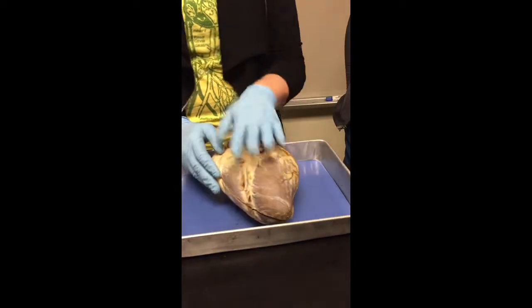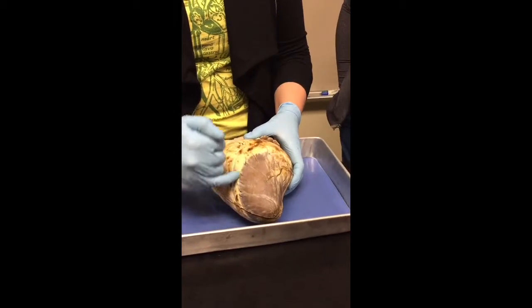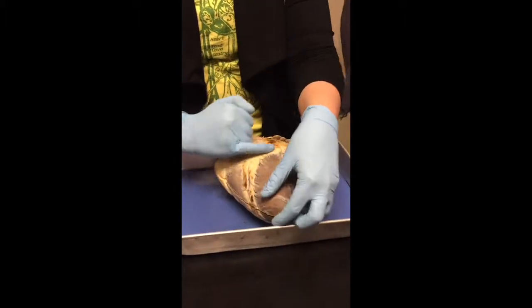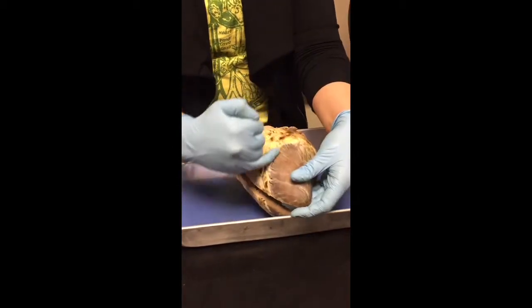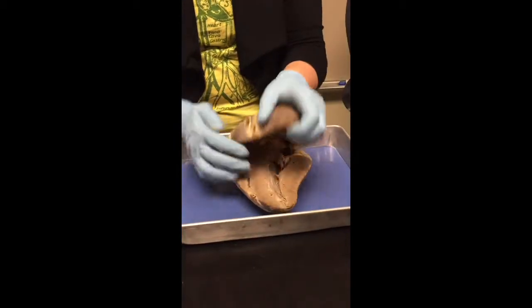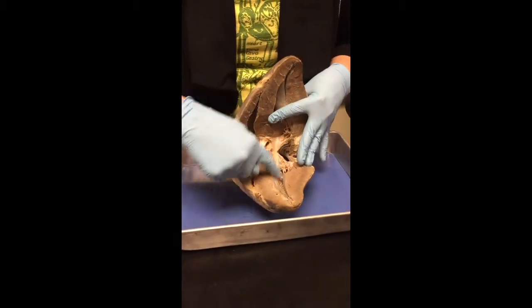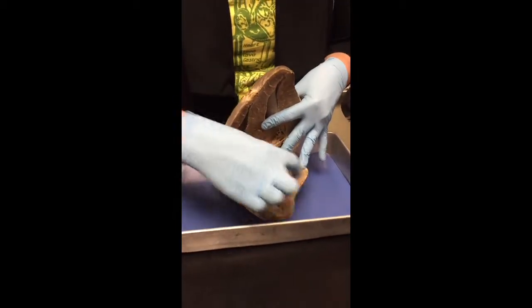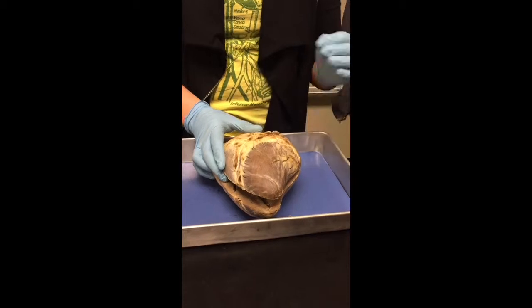On the front of the heart, so here's the anterior part of the heart, this right here, you can kind of see what looks like a groove. This is called the interventricular groove, right? It's just a way to help orient yourself. Interventricular groove, you can see that it kind of goes along with the interventricular septum, right? So left is going to be on this side, right is going to be on this side. And I know left and right because left is really big. Do you see the size discrepancy? This is huge, this is small. This is left, this is right, okay? And I know that because the left side deals with pumping oxygenated blood to the entire body.